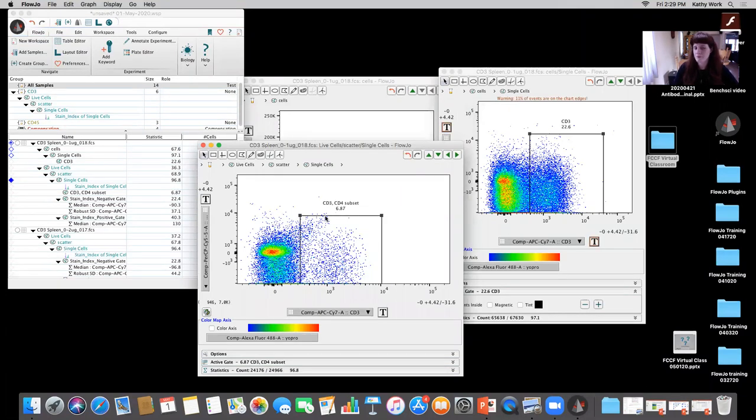that difference. You have 6.87%. You have 22.6%. Without the inclusion of a viability dye and without gating out my dying dead cells, I'm getting a dramatically different readout for what my CD3 positive population is, okay? It's not ideal. You don't want to do it.